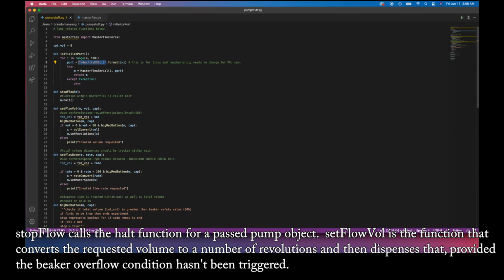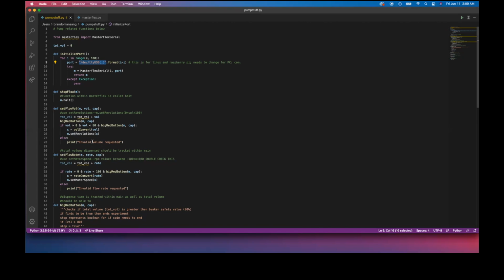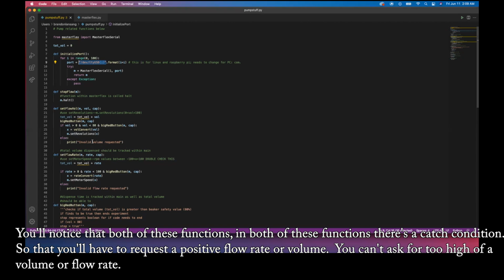Stop flow calls a halt function for a passed pump object. Set flow vol is a function that converts the requested volume to a number of revolutions and then dispenses that, provided the beaker overflow condition has not been triggered. Set flow rate pretty much does the same, except it does it for a continuous flow rate rather than a set flow volume. You'll notice that in both of these functions there's a catch condition, so you have to request a positive flow rate or volume. You can't ask for too high of a volume or flow rate.